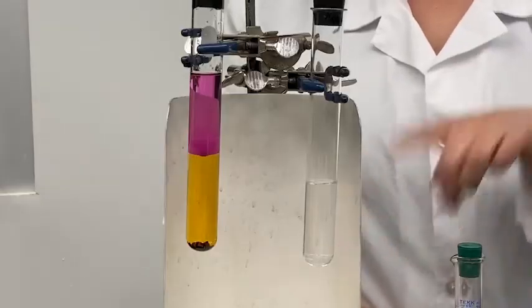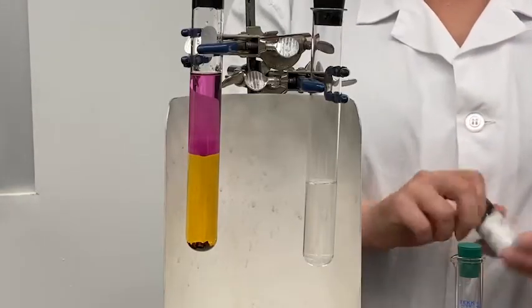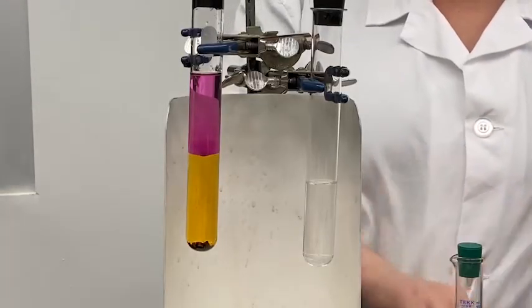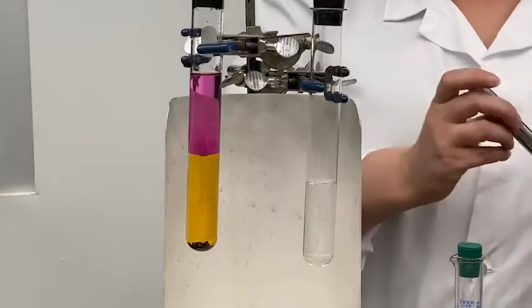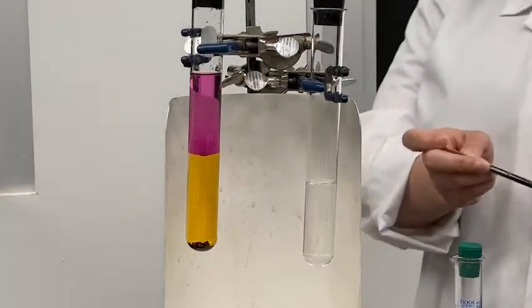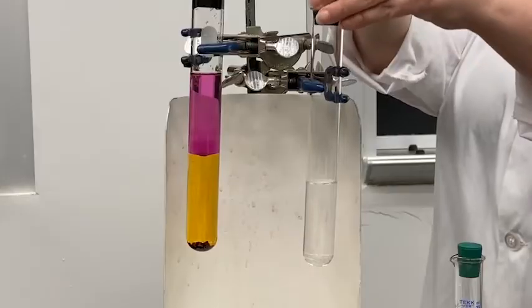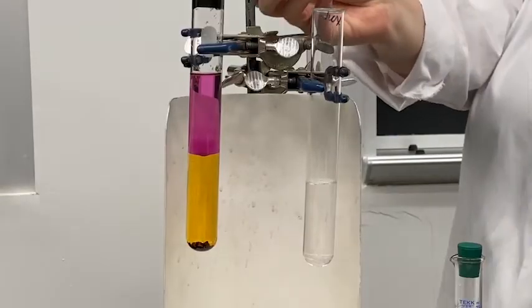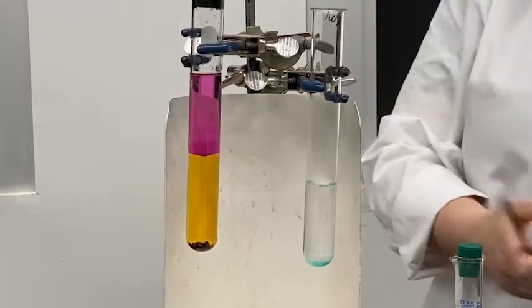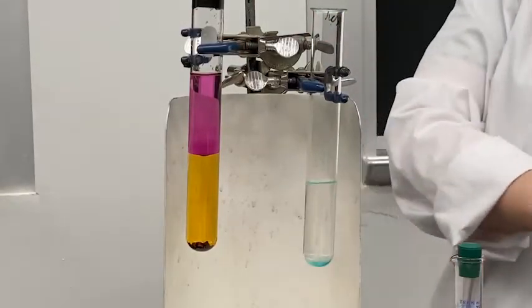Here I have hexane again, which is nonpolar, and I've got some copper chloride, which is ionic. You can see it sinks right to the bottom.